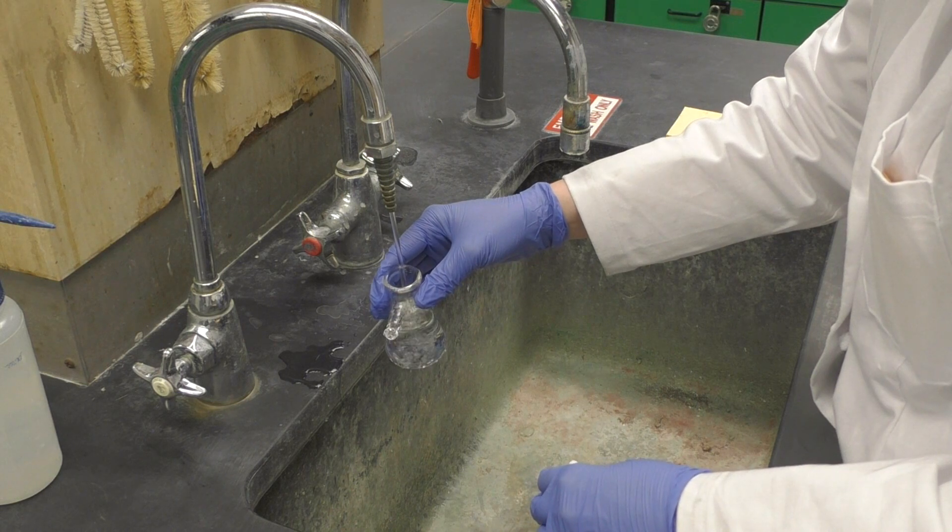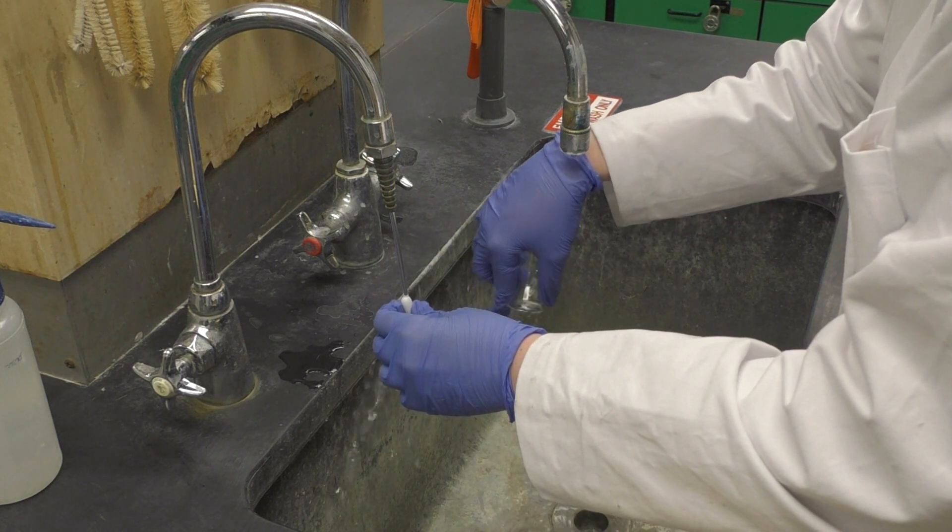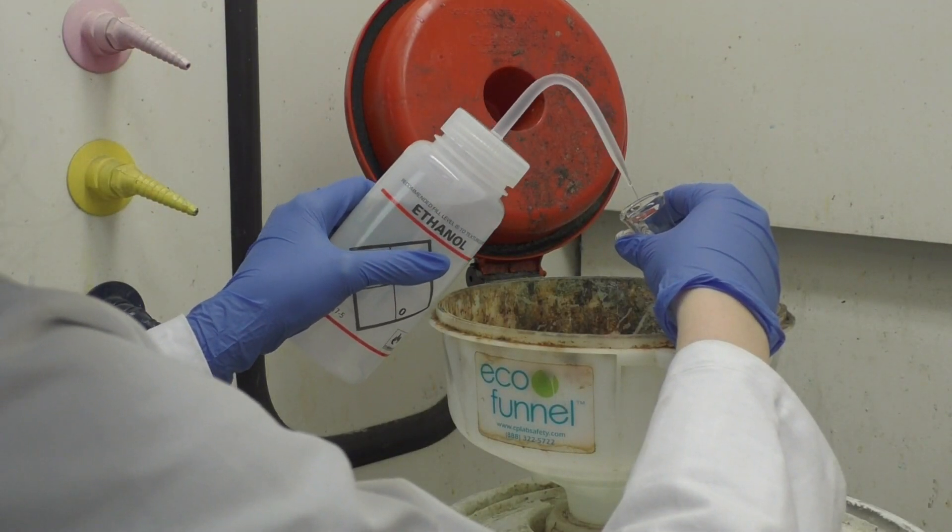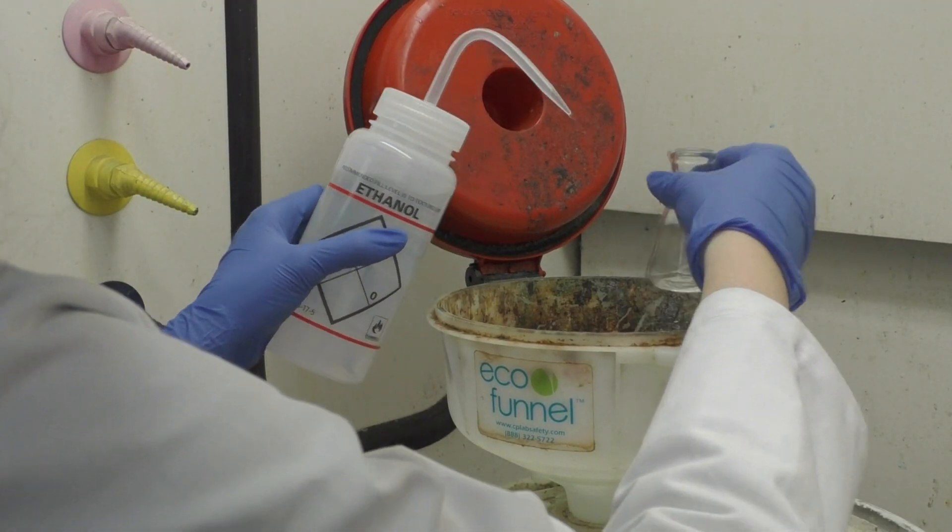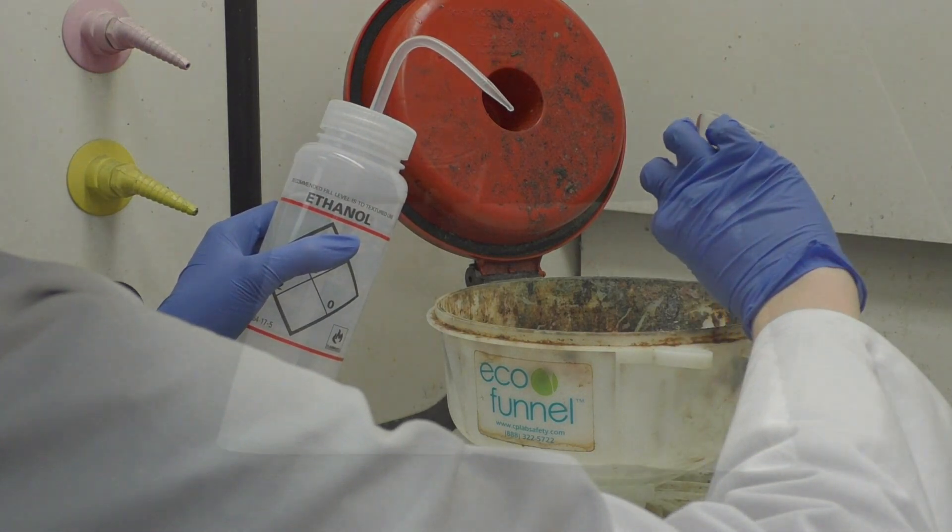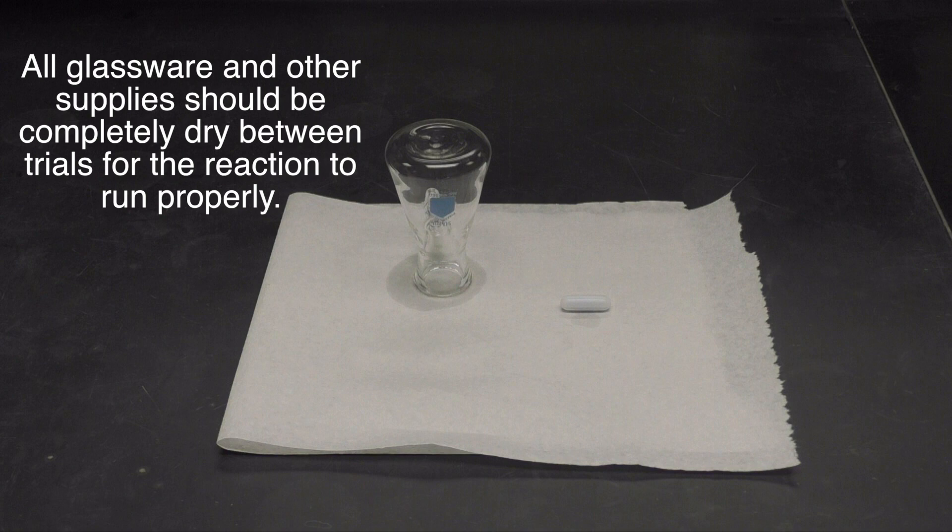Then make sure you rinse everything with deionized water at the sink. If you are using the same equipment again for more trials, you should rinse your glassware with some ethanol in the waste hood, as this will evaporate in just a few minutes. Leave your wet supplies out to dry on a paper towel between trials.